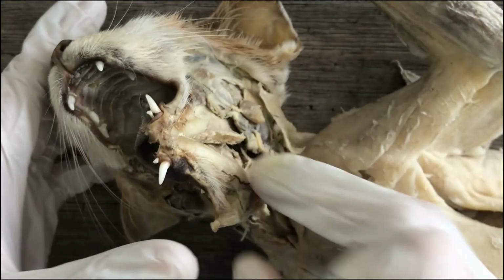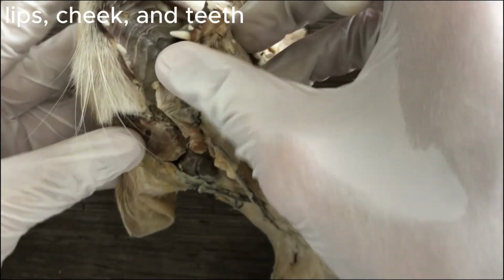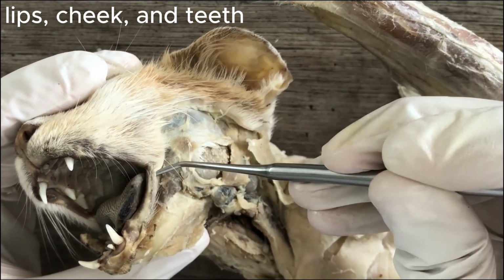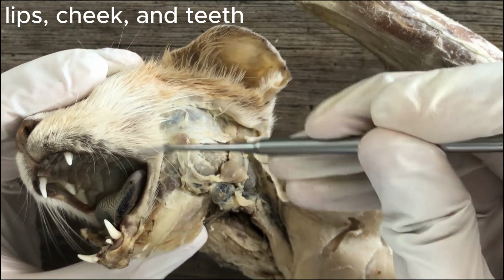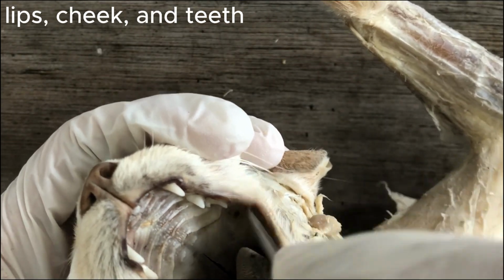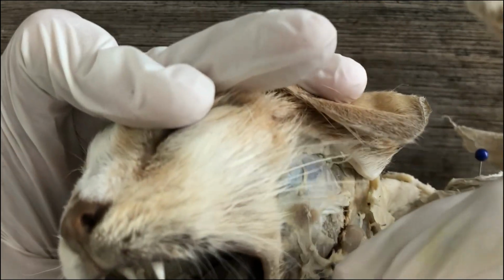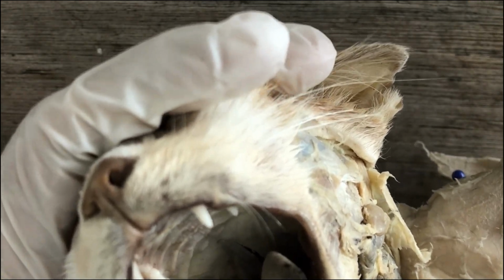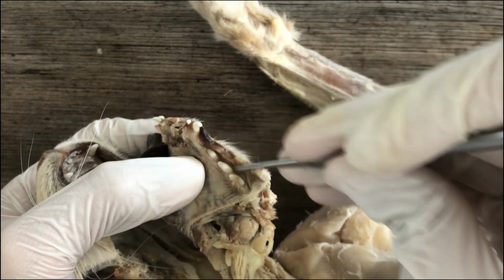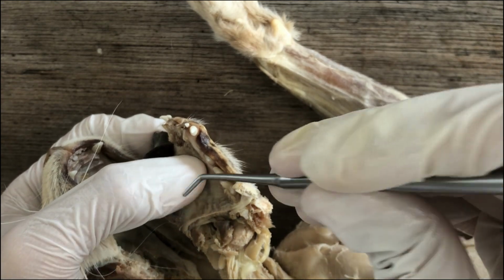So what are the oral structures? You have to know there's the lips, there's a cheek, which is just a flap of skin surrounding the lateral walls of the oral cavity. Lips. This would be the teeth, obviously. And then the space in between the teeth and the lips, where our gums are located. That's the vestibule.